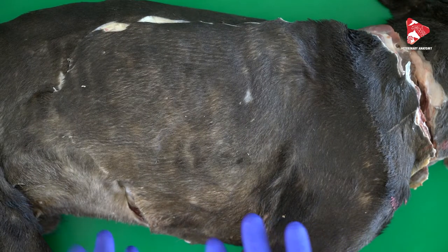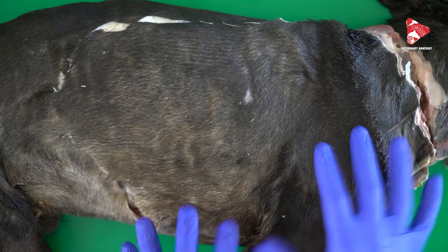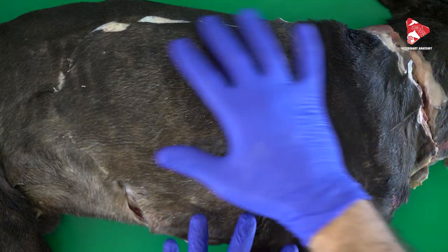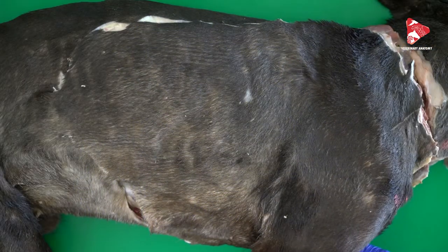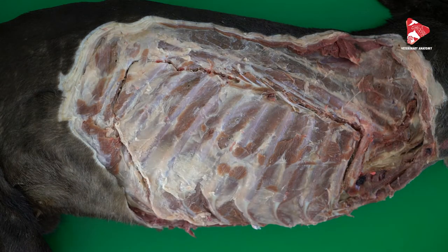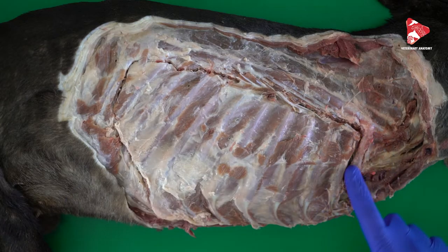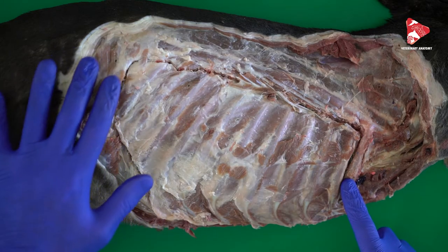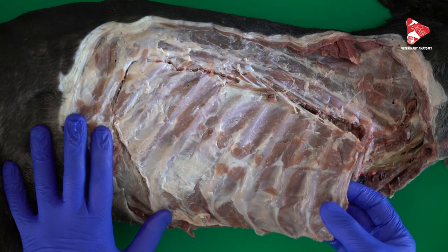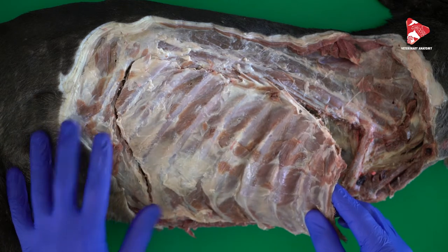Here we move to the right side where we also cut the muscles connecting the forelimb to the trunk, to the neck, and to the back, and remove it completely. We remove the forelimb. After that, we kept also the first rib and the last two or three ribs, and cut all the ribs so that we can look into the thorax cavity.